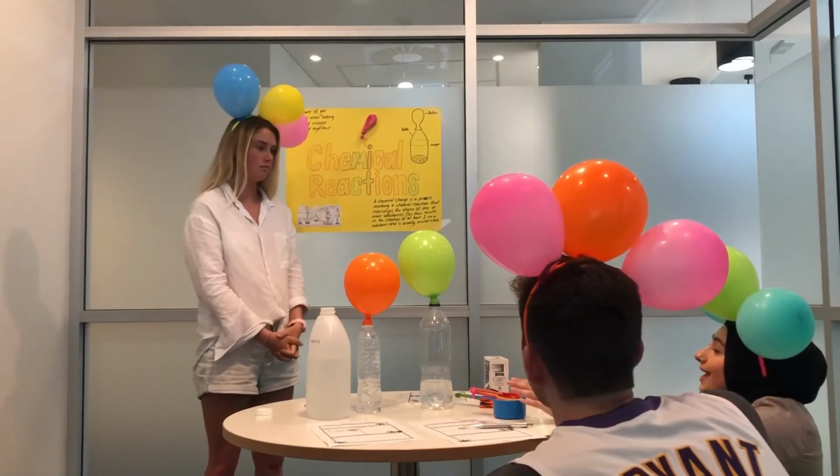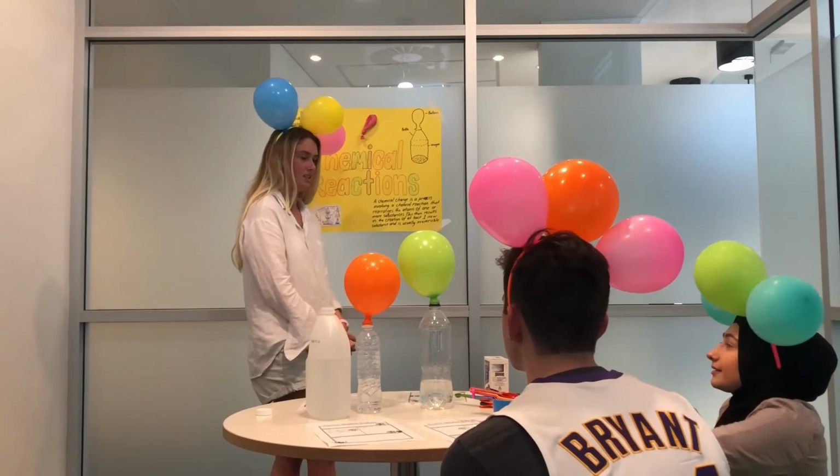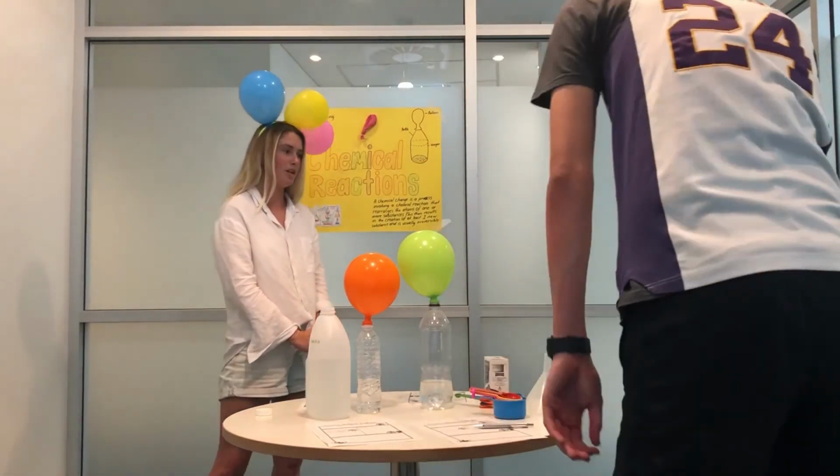Okay, so the gas is carbon dioxide, is that it? Yes. Okay, oh, cool. Good job today, guys. Awesome. Did you enjoy this experiment? Yeah, this was fun. Oh, awesome.